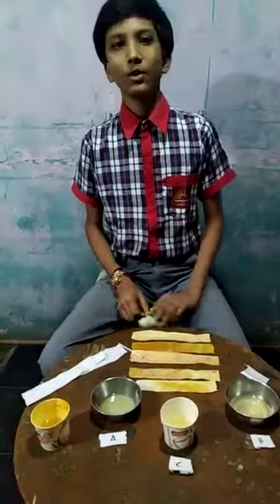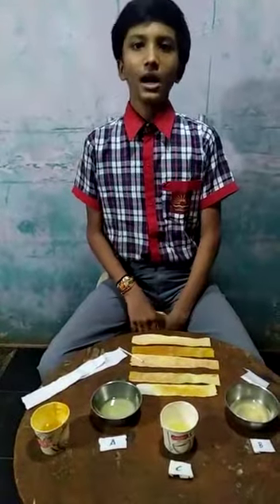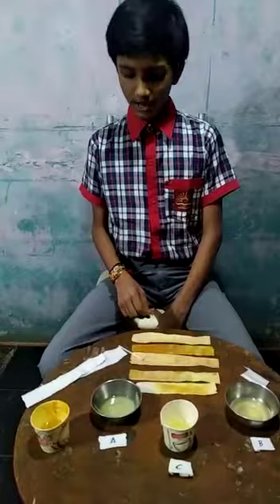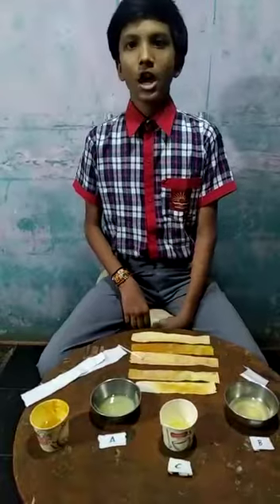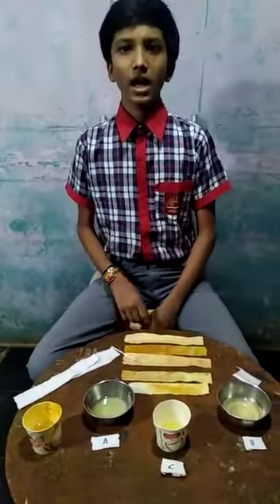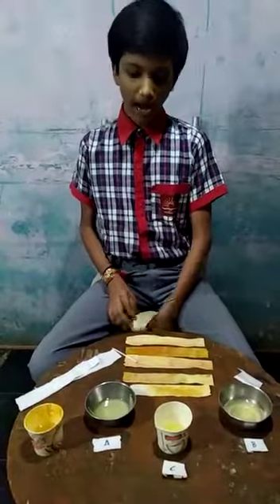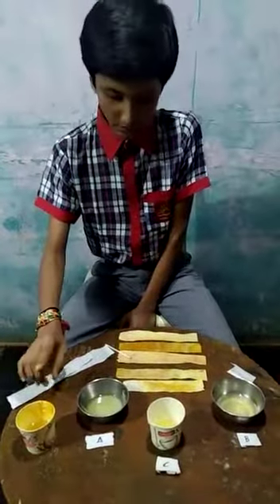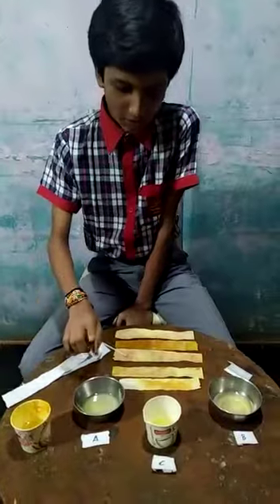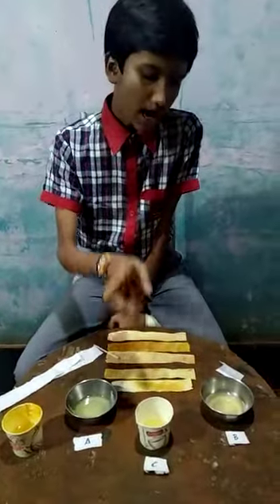Hi friends, I am Vyvody Patthar of class 7th. Today I am presenting an experiment on identification of acid and base, assigned by Dimpal Parikh ma'am. I have taken the first solution: turmeric solution, lemon solution, alkaline solution, and soap solution.